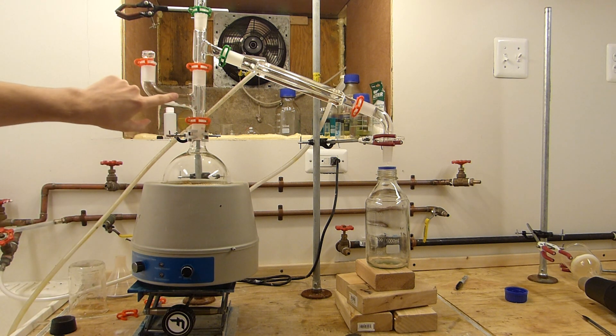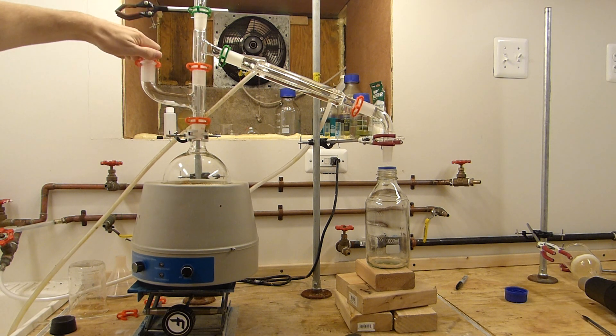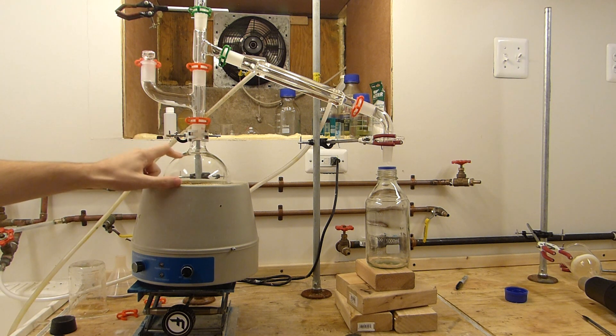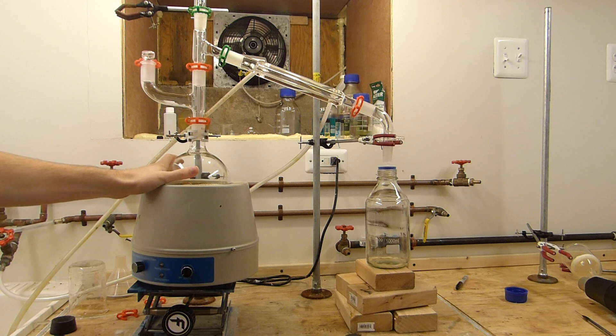But I've added this piece in here which will allow me to pour more ethylene glycol, in this case the antifreeze solution, into here to keep more and more coming out. So I can refill this halfway through the reaction as long as I'm careful about the thermal shock on this flask.